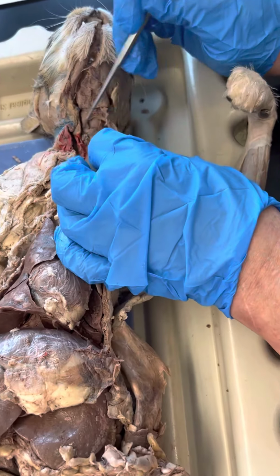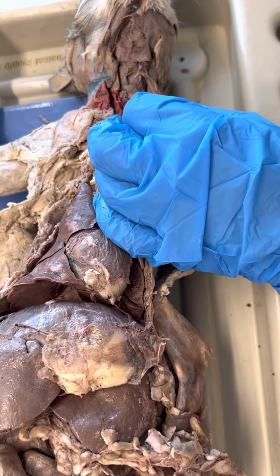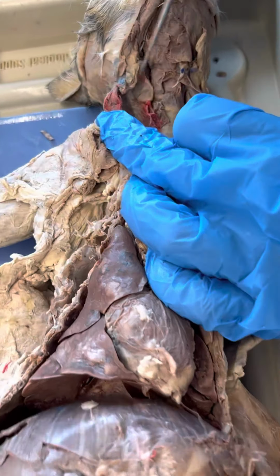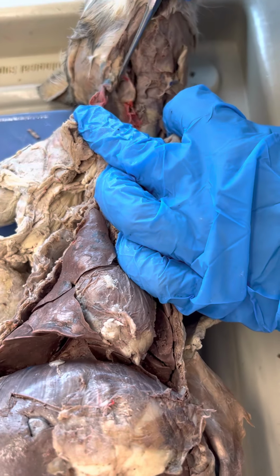Okay, and then you do have the thyroid gland. I don't think they have it on here, do they? No, usually. Yeah, they do. I thought they did. Yeah, but usually they're gone on the cats because when they dissect the neck and everything. Well, here it is. This is a thyroid right there. I can usually find one. Gland? Yep, they're pretty big.